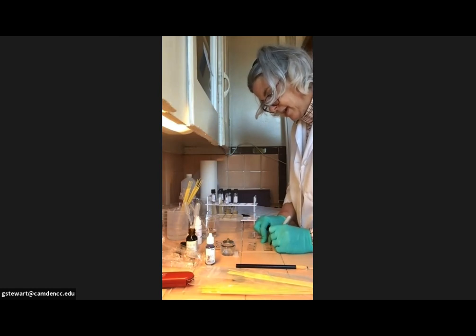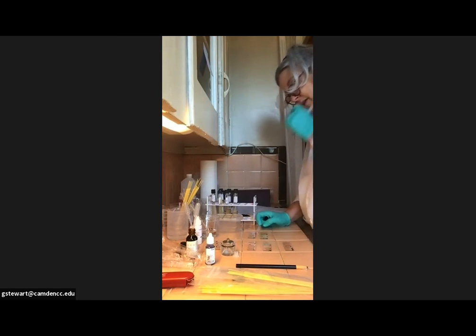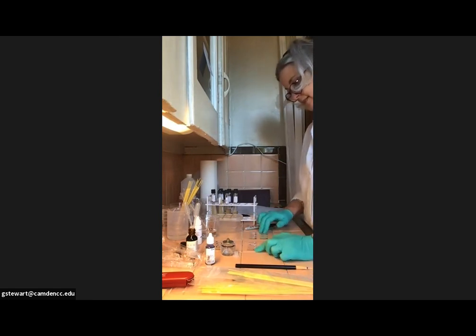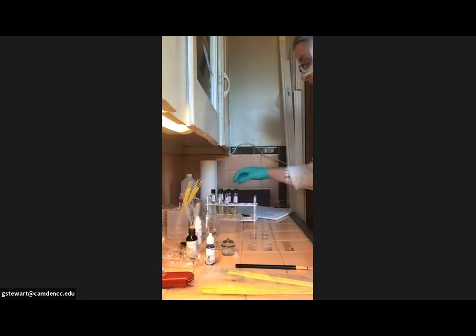2A, 2B. And then in your notebook, I would write down which bacteria you're going to call A and B and C and D. I might actually recommend a different way to do that, but for right now, we'll do it like it says in your booklet. So what I have written down is that we need to first put E. coli together with Serratia. So I'm looking for E. coli and Serratia, or sorry, E. coli and Staph epi is my choice. I think it tells you can do them in any order that you want.